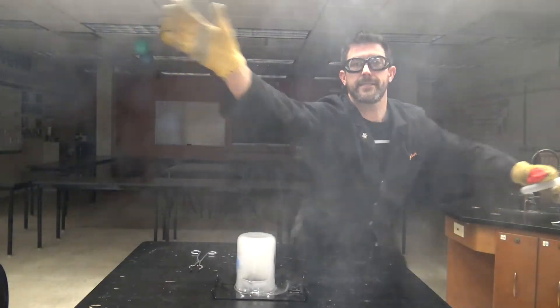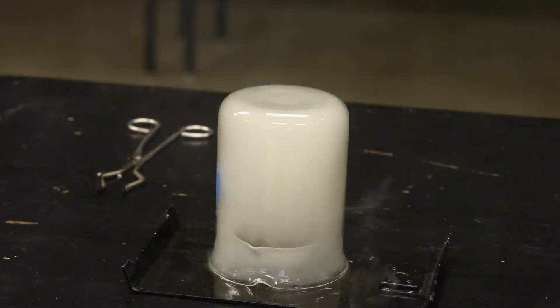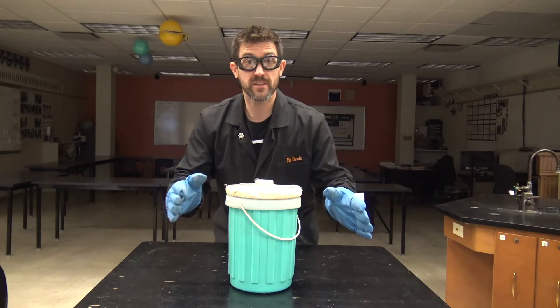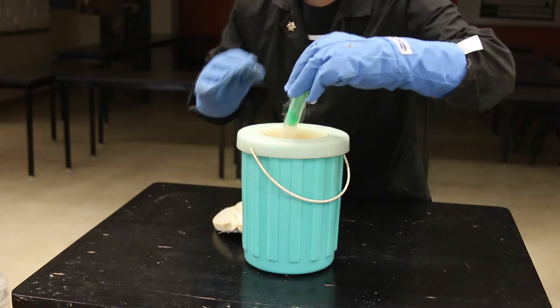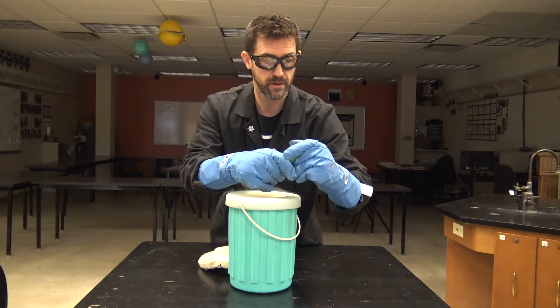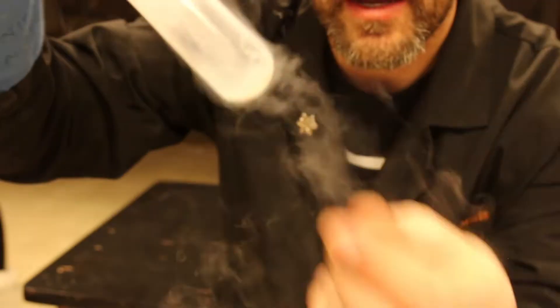Nothing to see here. And just to prove the point, when we take oxygen away the flame goes out. Liquid oxygen has some interesting properties. For one, we tend to think of gases or liquids as being clear, and in general they are. But liquid oxygen — it's blue.